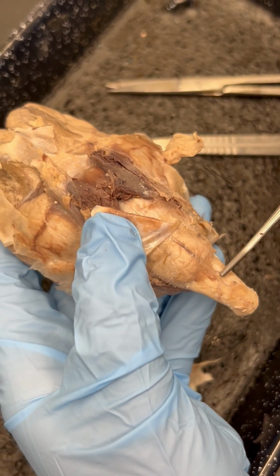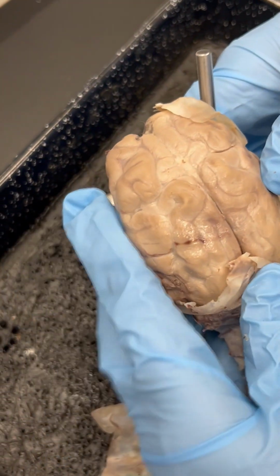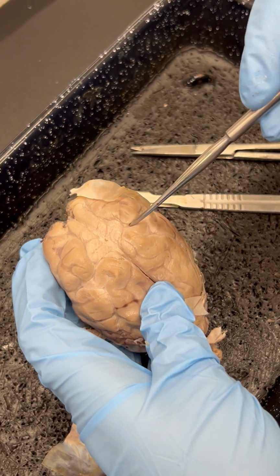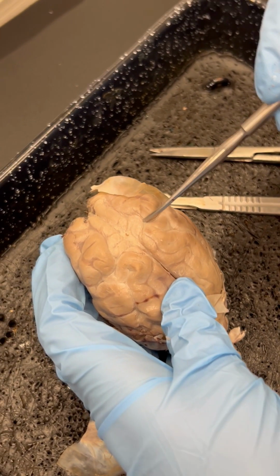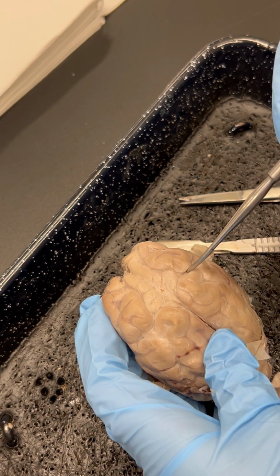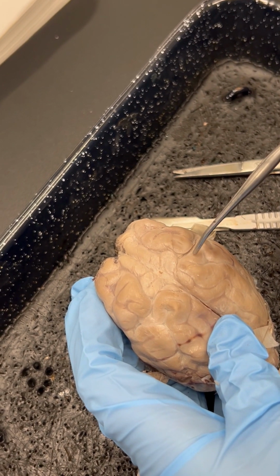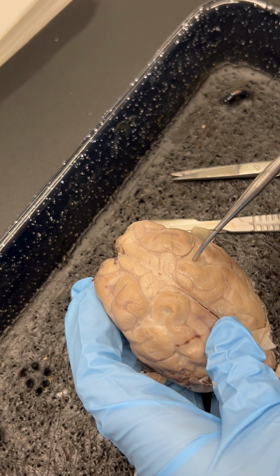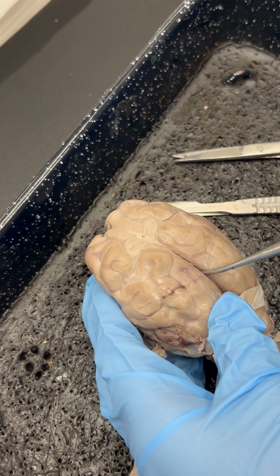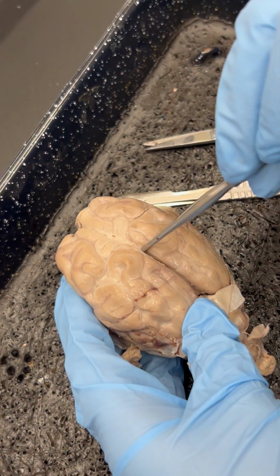So we're going to trace back to figure 10.10, and go over the terms that we want you to know. Number one is sulcus. These are the grooves in the brain that are separating out number two, which is the gyrus. Here are examples of gyrus. Number three is the median sulcus, which is going to divide up and go through the cerebrum.